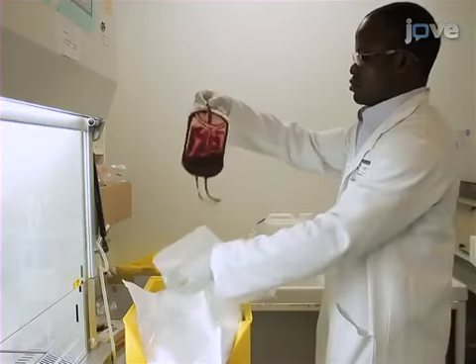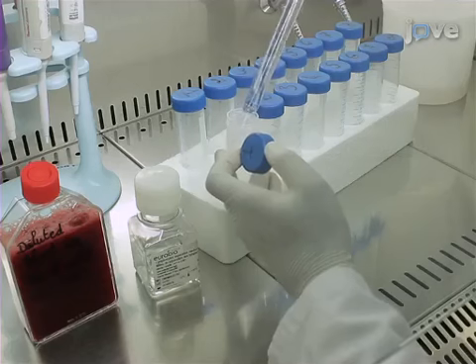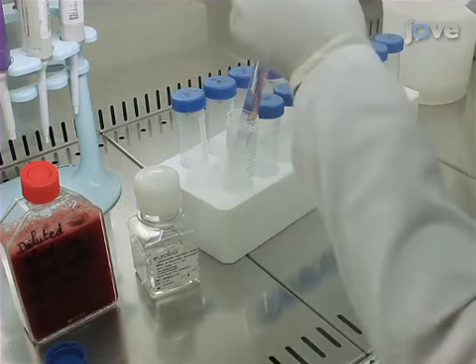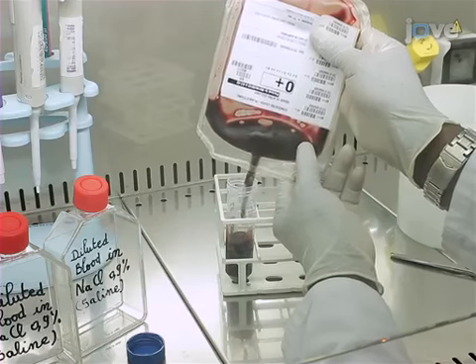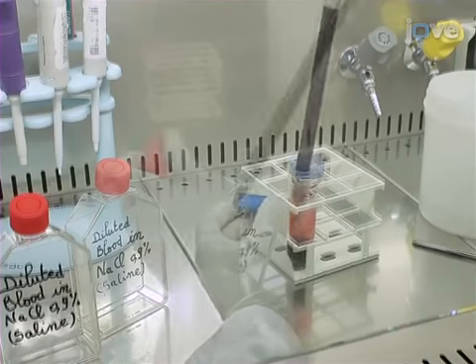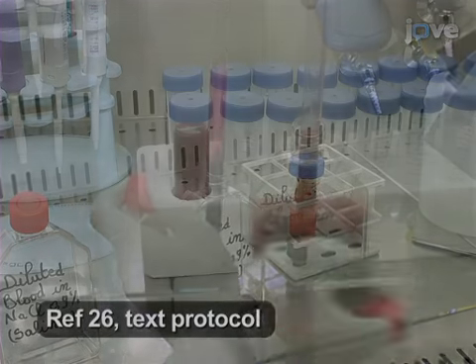Isolate the cells from leucopaks. In 50 ml tubes, add 15 ml Ficoll. Dilute the blood 10-fold in saline. Then separate 30 ml of the diluted blood on the Ficoll gradient.